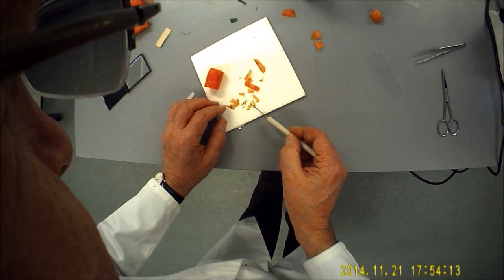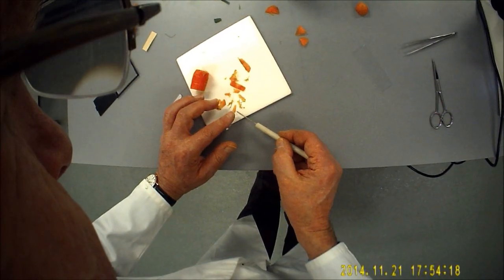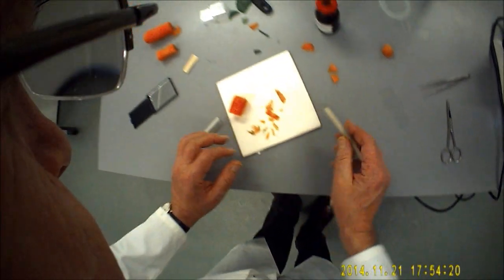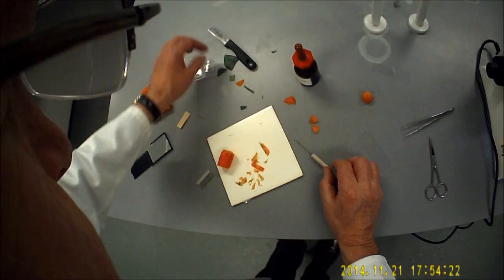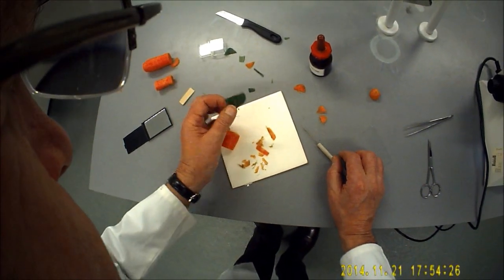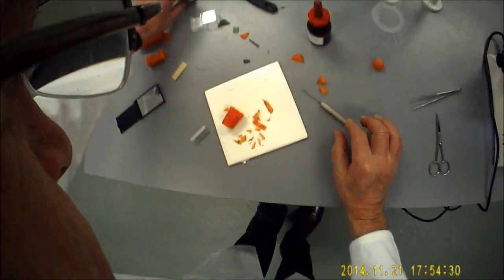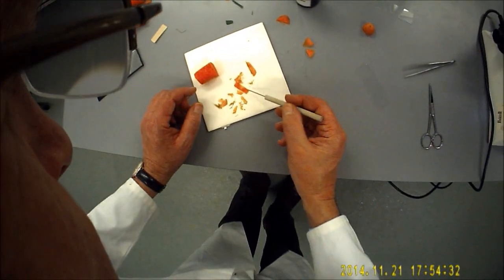What you need to make sure you do when you place the specimens on the microscope slide is to actually make sure that the leaf is that way up, not that way up, because you're going to try and look through the leaf in that plane there, okay?